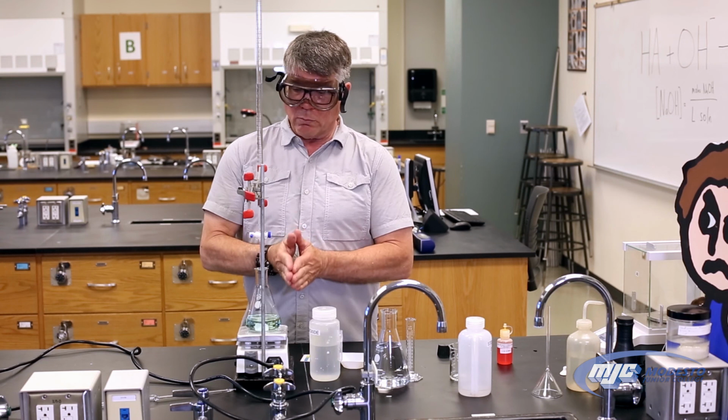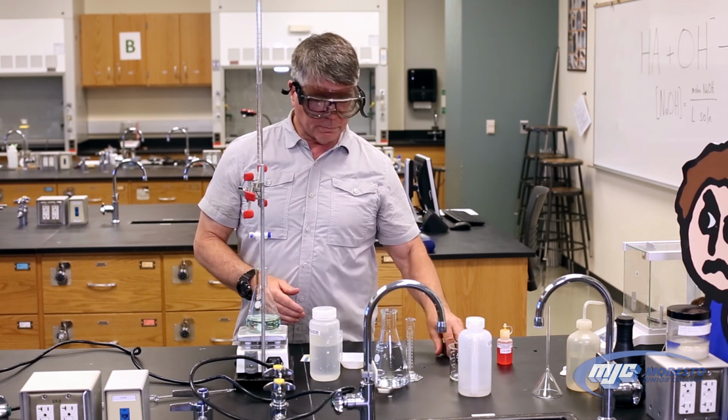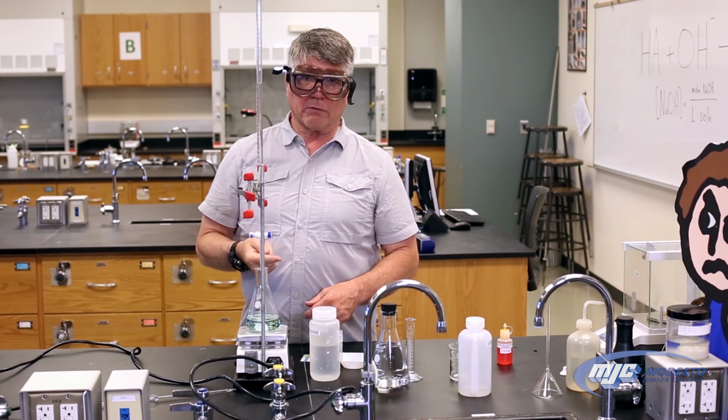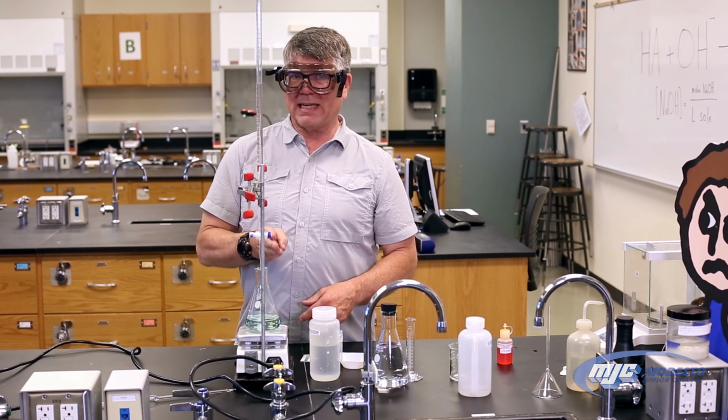So there's going to be 2 more titrations like this of the KHP to standardize our stock solution. Fill the burette back up each time. Take the next solution, titrate it just like this. And then we're going to do the same exact thing 3 times with an unknown acetic acid solution.